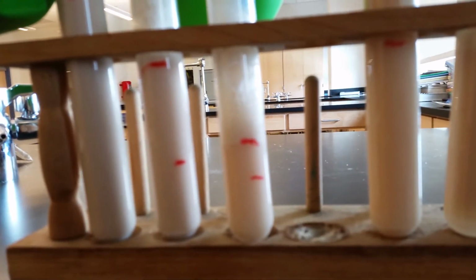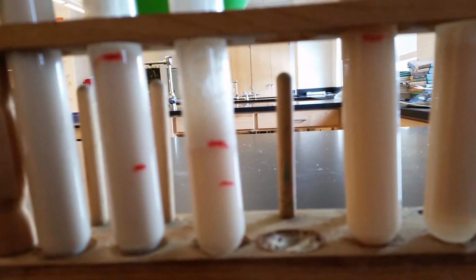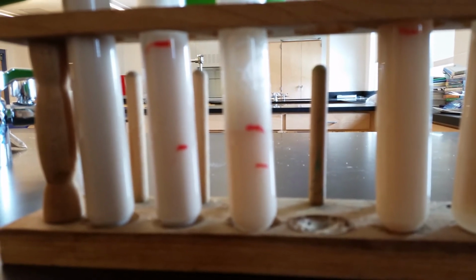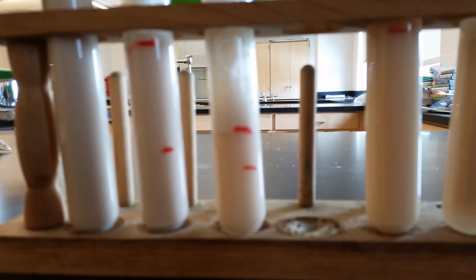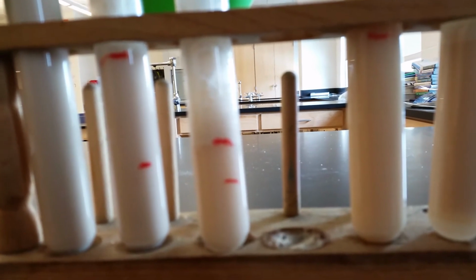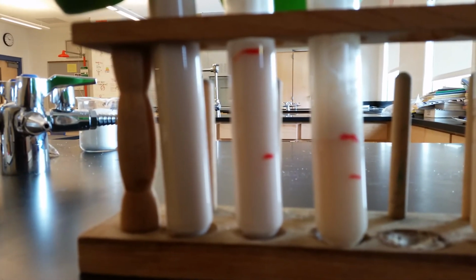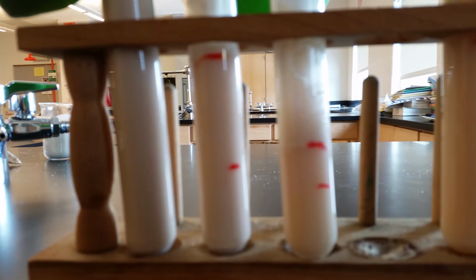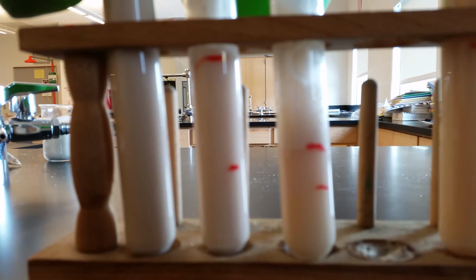Test tube B, I know it's really hard to see on the video because I can't get it to focus that closely. But in test tube B, the bubbling is pretty active coming up from the bottom. C, D, and E. Okay, so the bubbling is pretty active in C, D, and E. Carbon dioxide is being formed. Test tube B also has bubbling, but it's not as active. It's pretty much just bubbles forming in certain spots, while in test tube C, D, and E, the bubbles are all around and they're rising pretty rapidly.